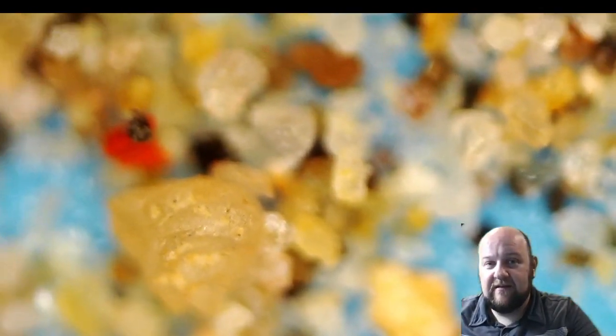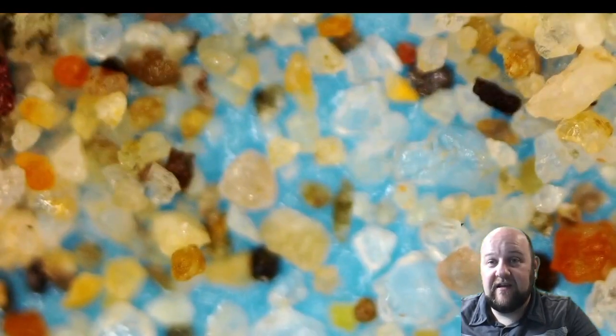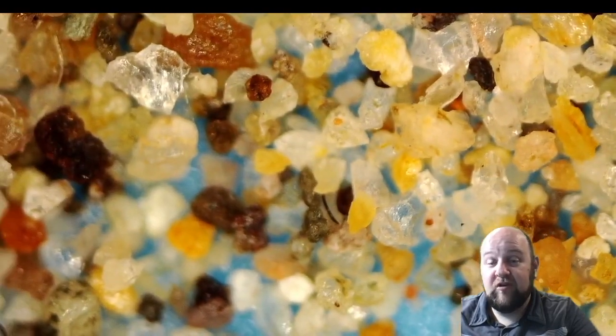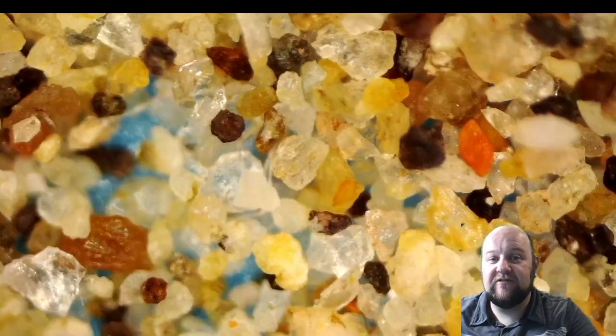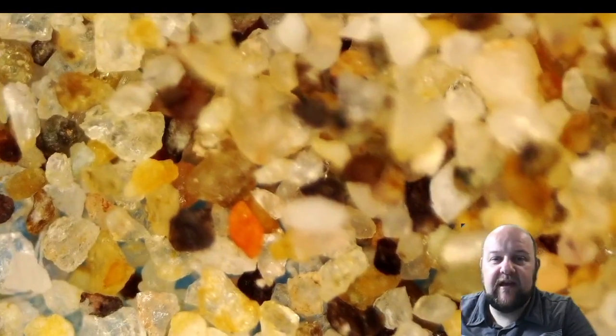But I like to think that it came from the sand, or at least it really liked the sand, and I saw it on the beach sand, but I did not see it on the playground sand. But then again, could have come from the playground sand and went over to the beach sand and thought, hey, this is interesting, new type of sand to look at.